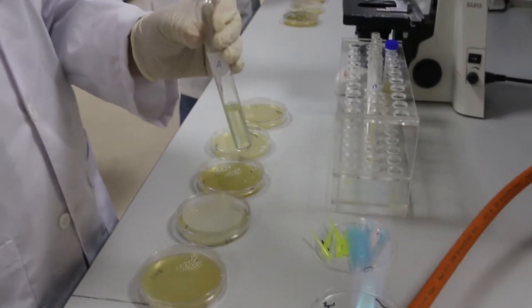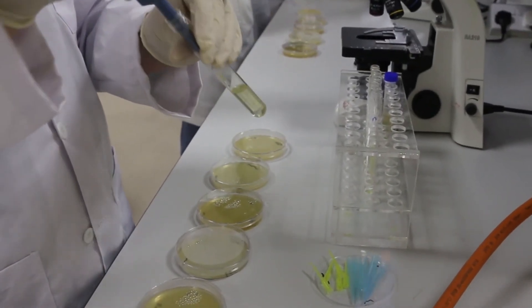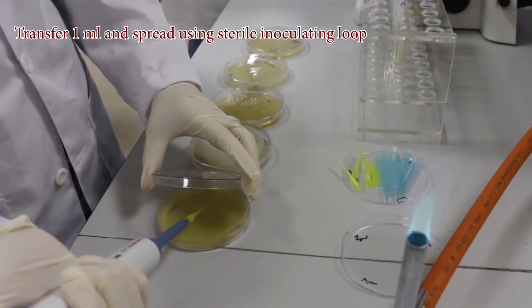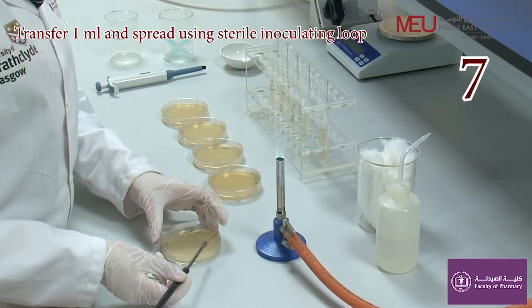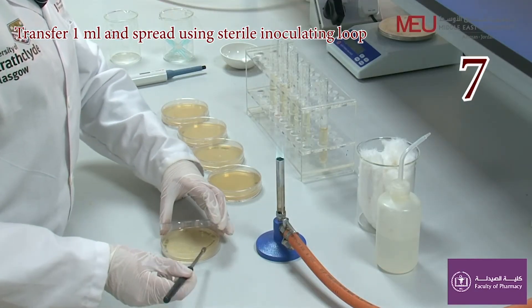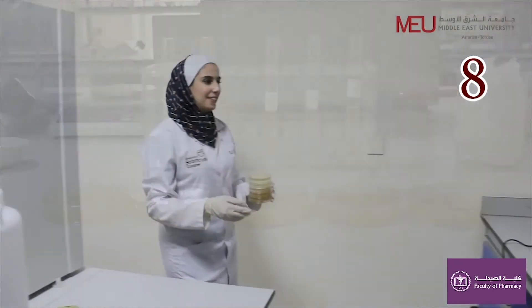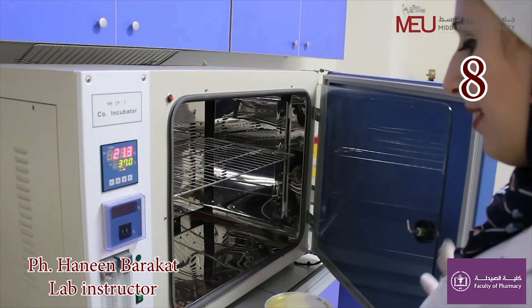Transfer an inoculum from each test tube into the corresponding agar plate. After streaking all agar plates, incubate in the incubator for 24 hours and don't forget to put them inverted.